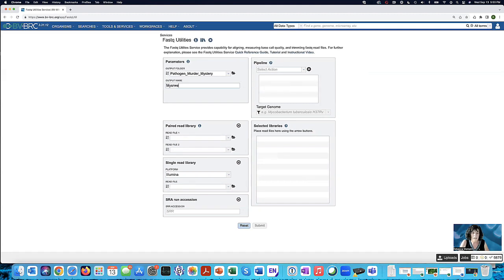It needs a name. And when I've done everything, when I can submit the job, this will turn blue. Mystery reads FastQC. Okay. So I've got a folder and I've got a name for this job. The pipeline I want is FastQC, which is doing the quality.